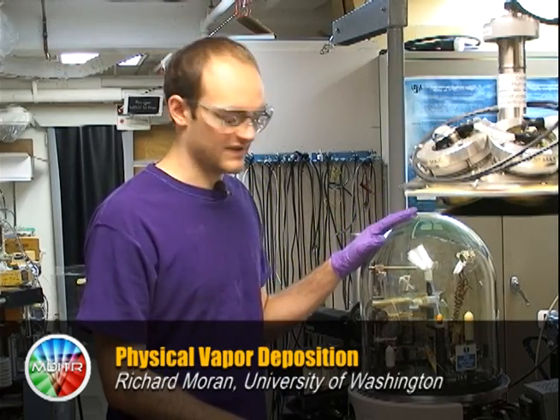My name is Richard Moran. I work for the Department of Chemistry at the University of Washington and I'm going to show you how to do physical vapor deposition.